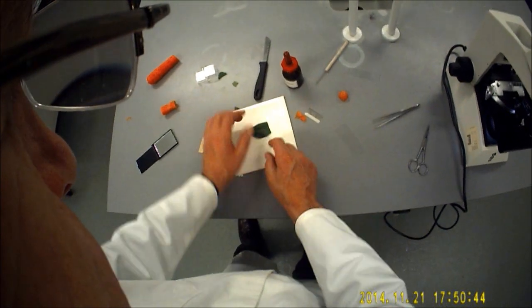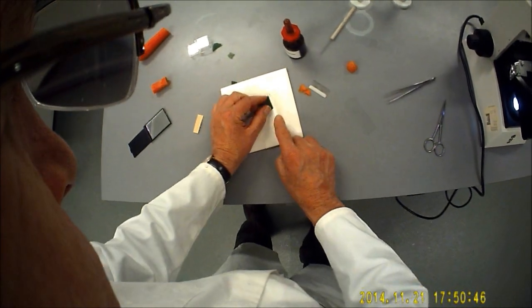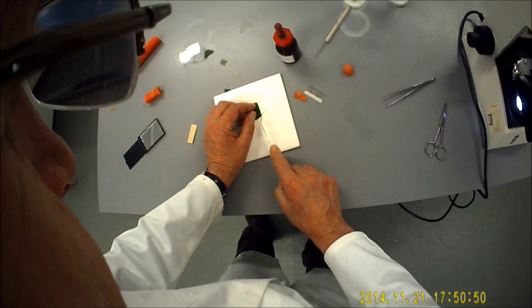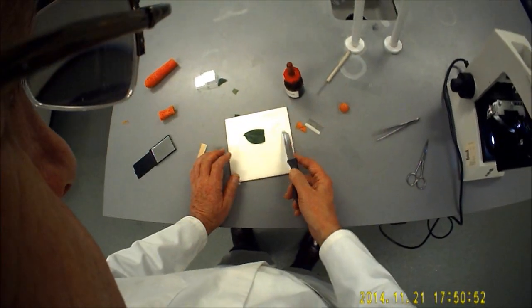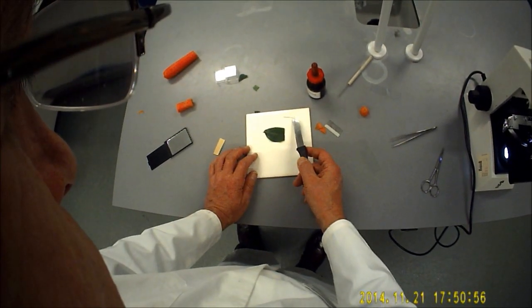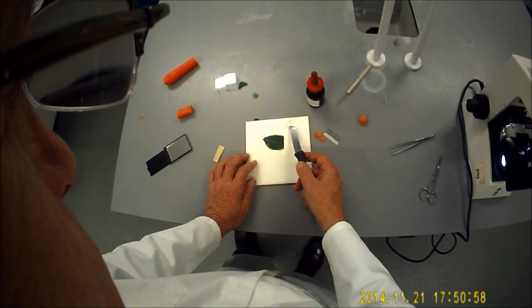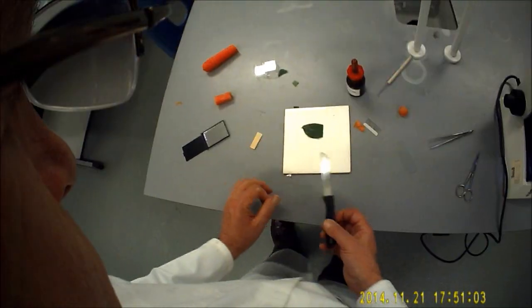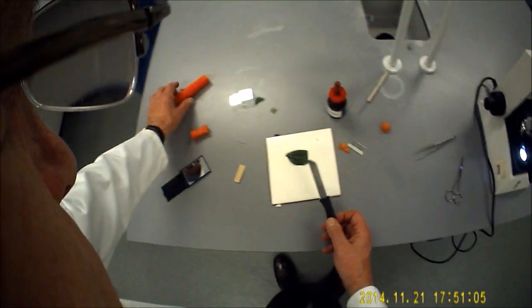The trouble is, of course, to actually do that as it is, no matter how careful we are, it's going to be very difficult to actually get a specimen thin enough to look through with the microscope. That certainly wouldn't be possible to look through that with a microscope, so we're going to use an age-old technique using the humble carrot.